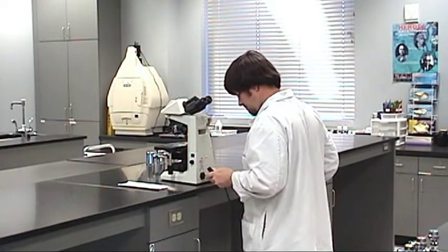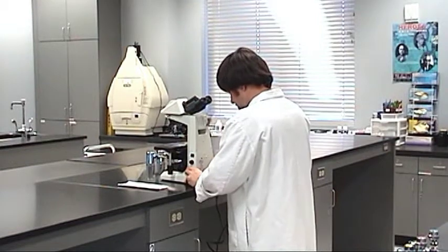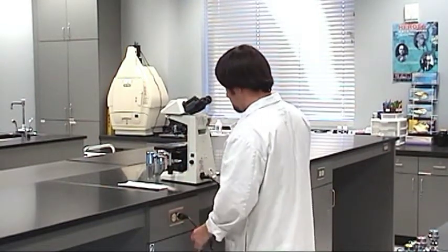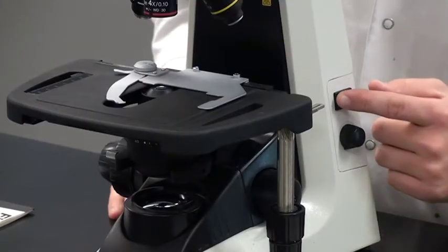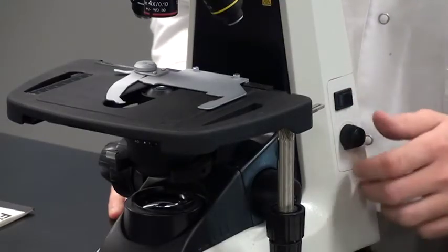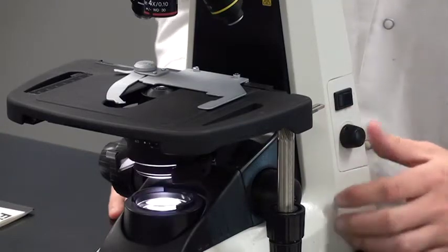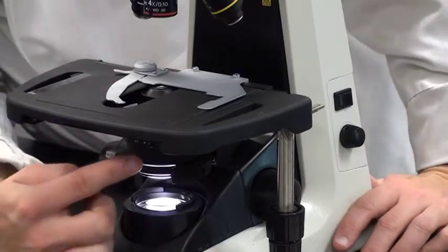Place the microscope on the bench and plug in the power cord. Turn on the light switch and adjust the rheostat until the light is bright but not blinding. Once this is set, you normally do not need to adjust it again.